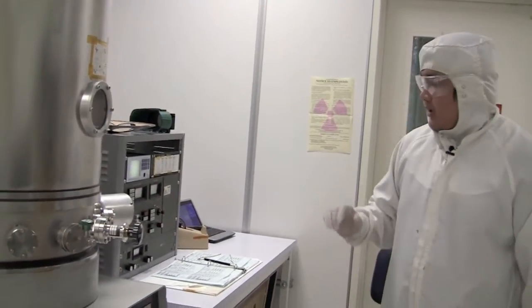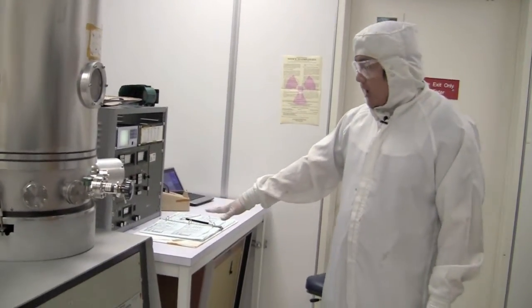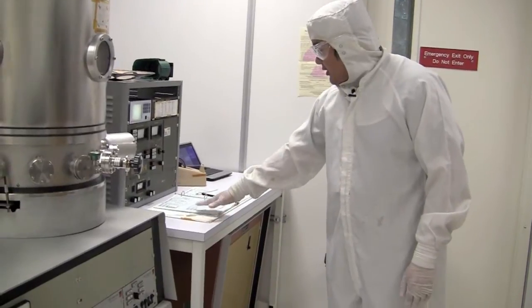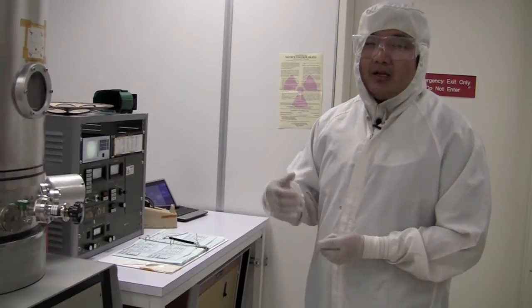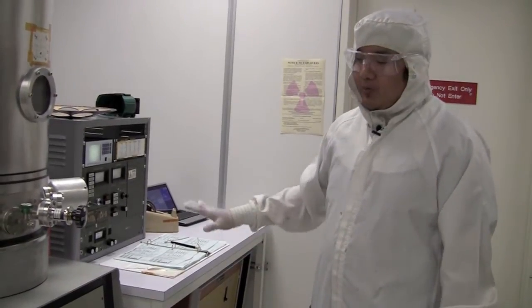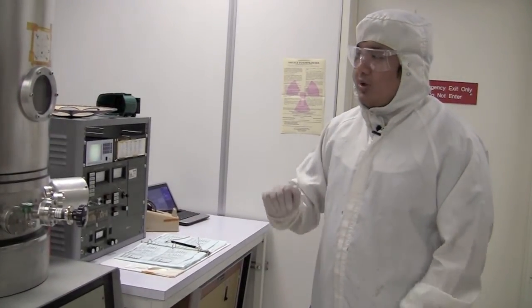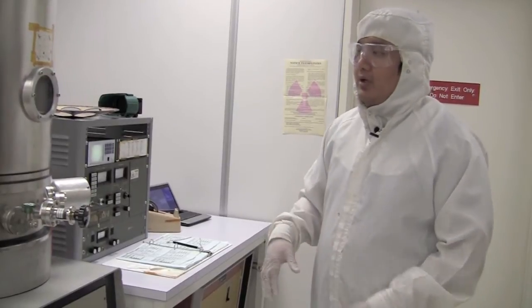Once you've logged into the system, you want to write into the logbook. So in the logbook, you would write your name, the time you're using it, the material you're depositing, the base pressure, and then once you log in, you are ready to start loading your sample on a substrate.